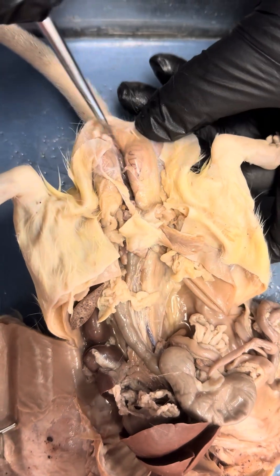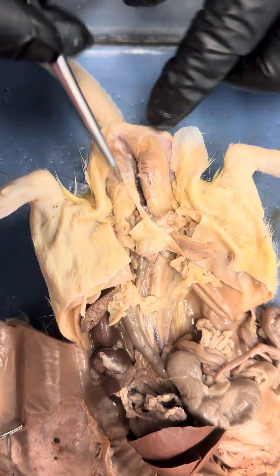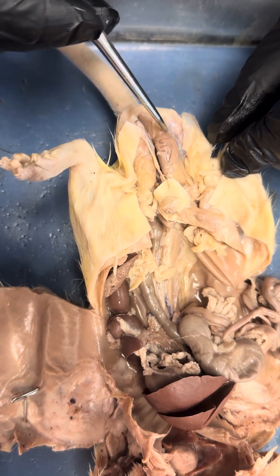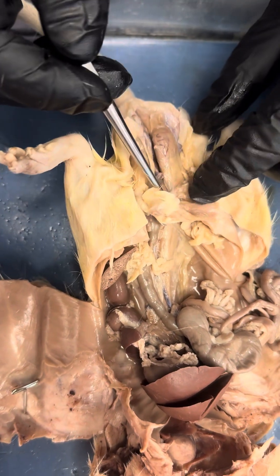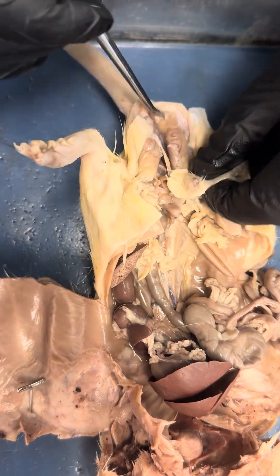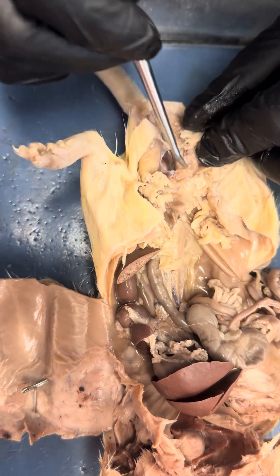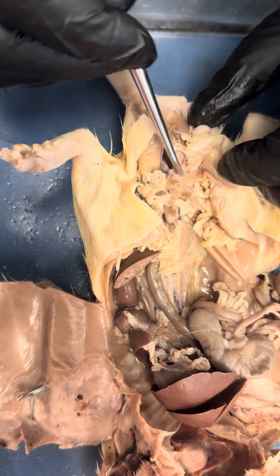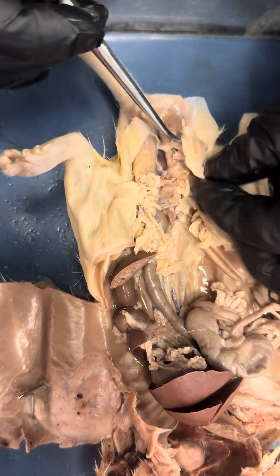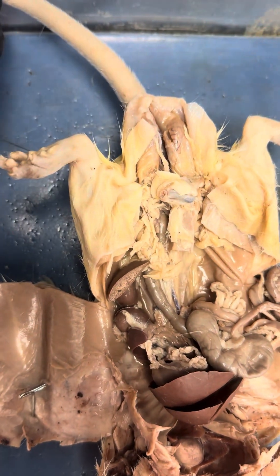The epididymis goes all the way down to the inferior surface of the testes. Sperm will be stored in the epididymis, and it comes out through the vas deferens. You can see the vas deferens starting here. So this is the right and left kidney. You have a urinary bladder, the penis — that's it from the male reproductive system.